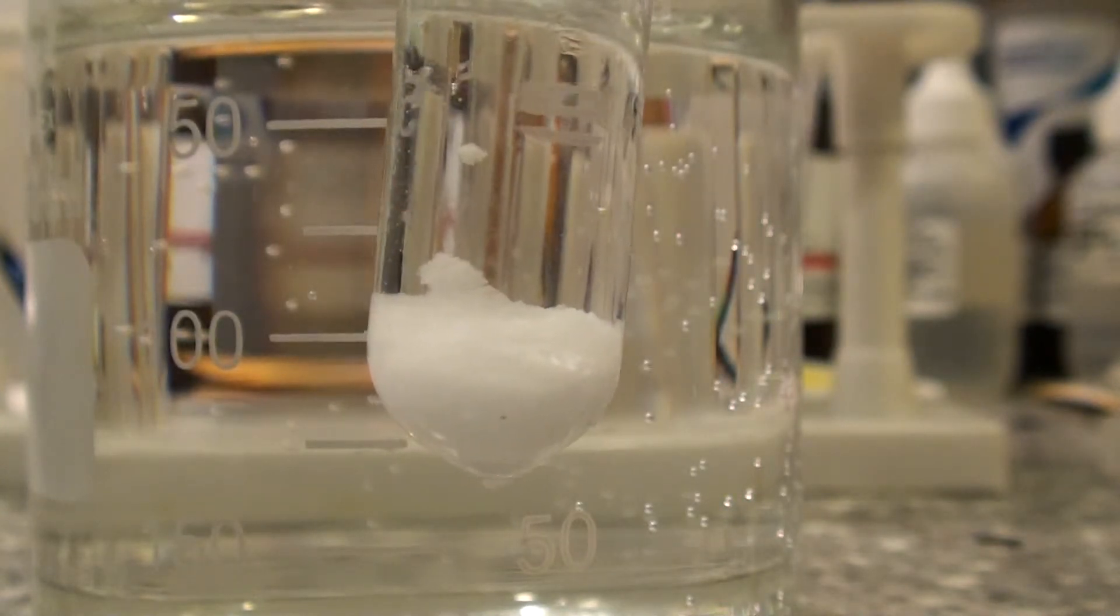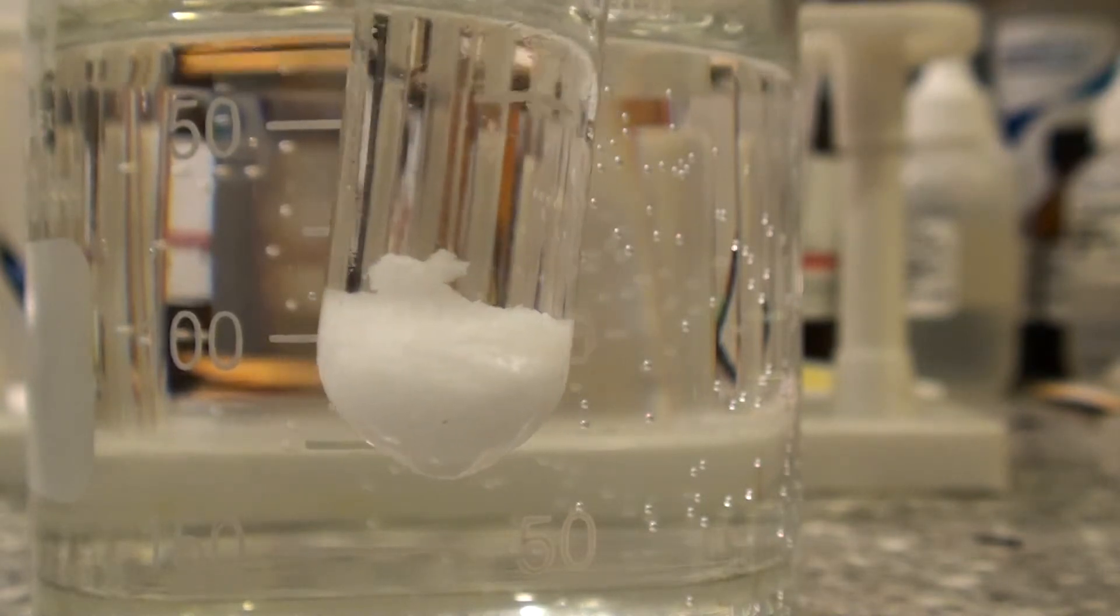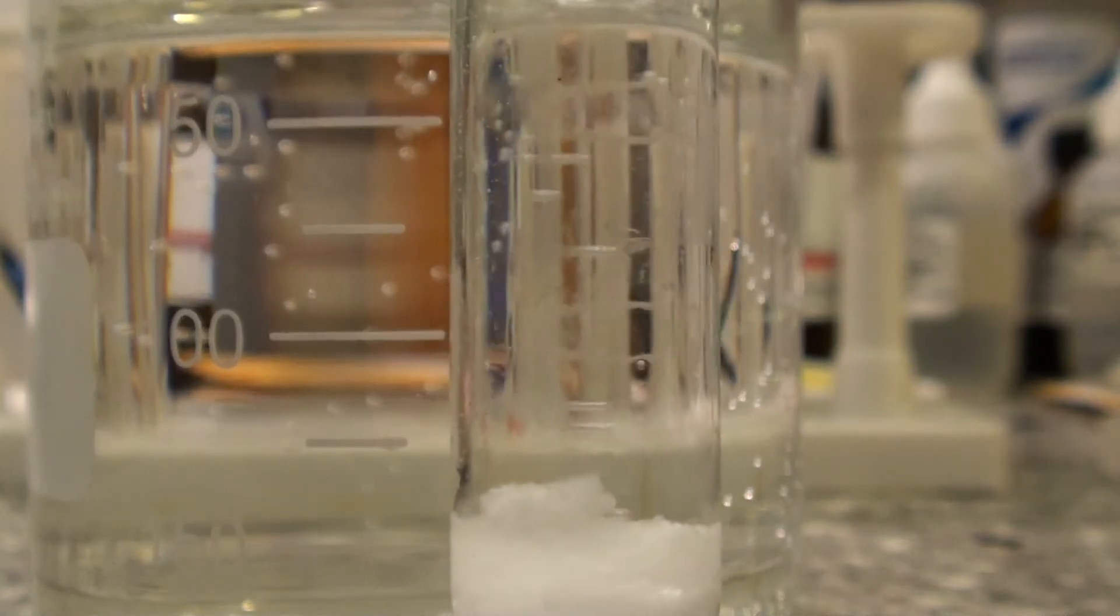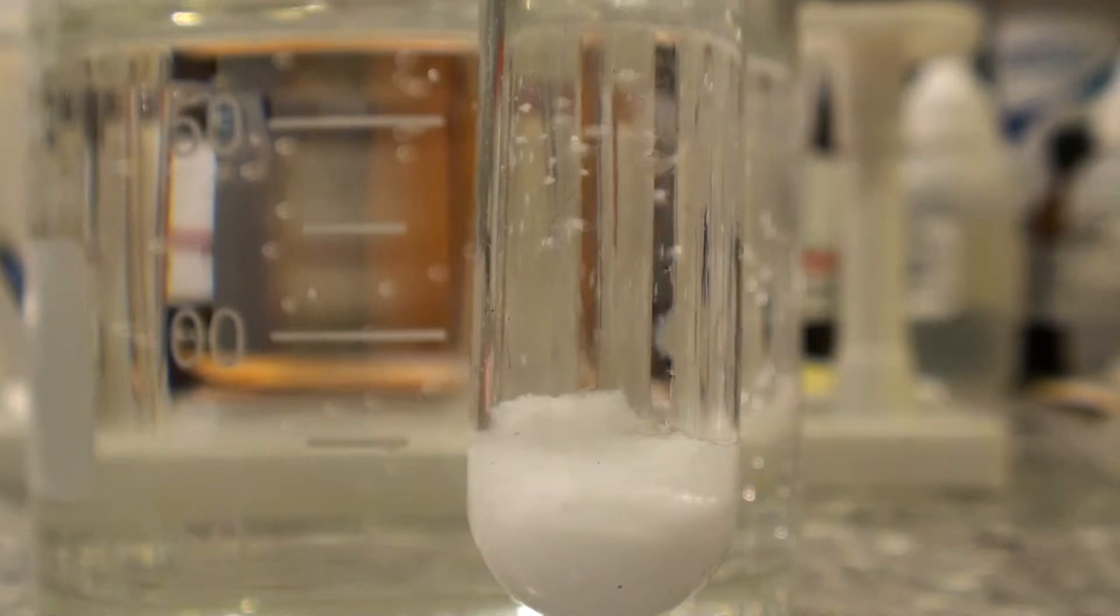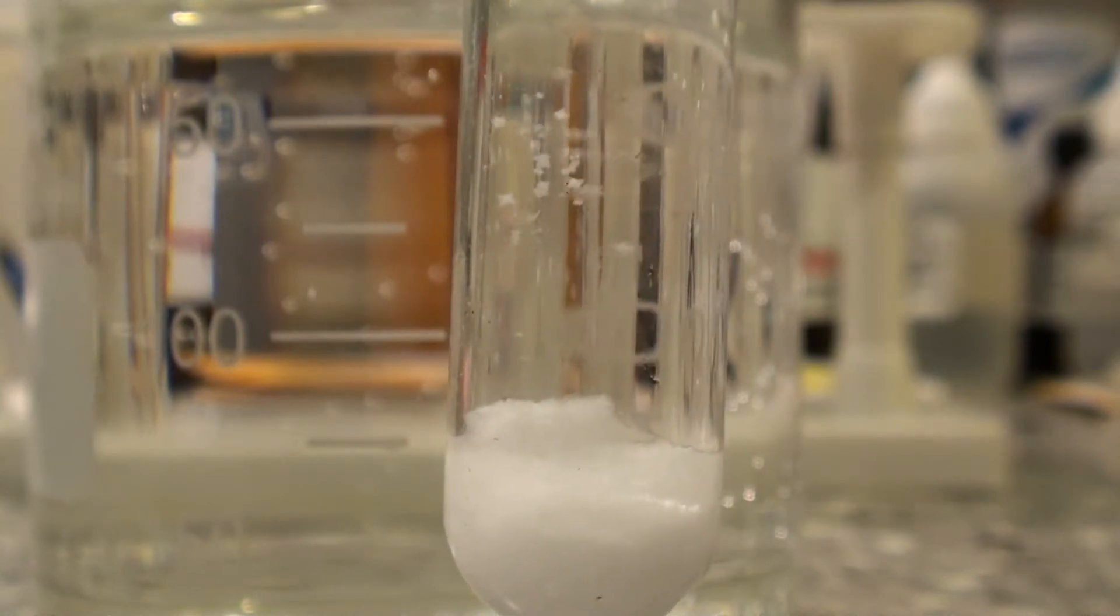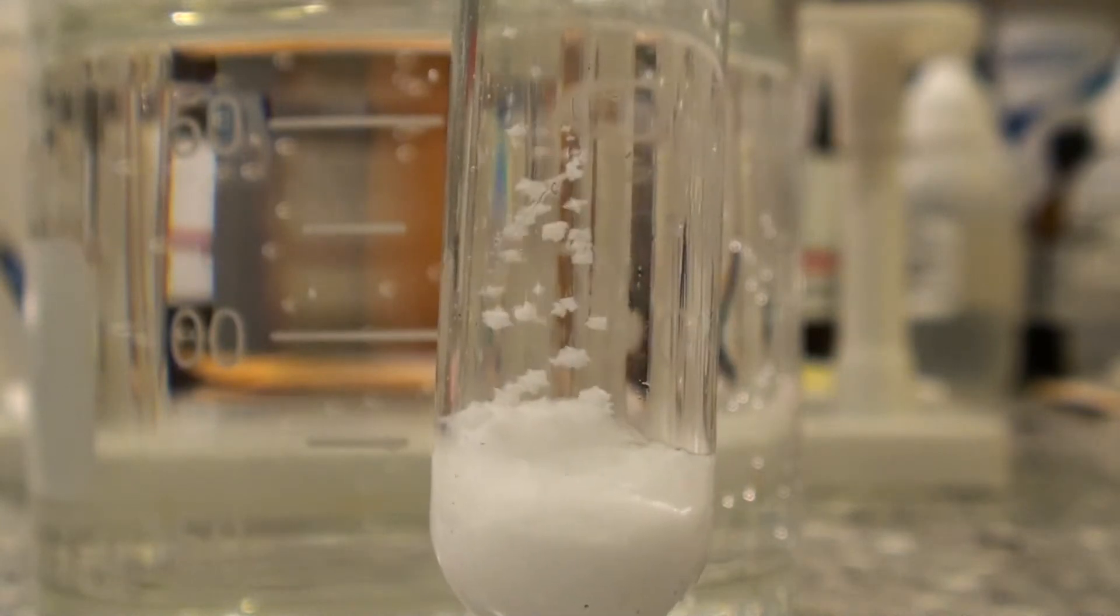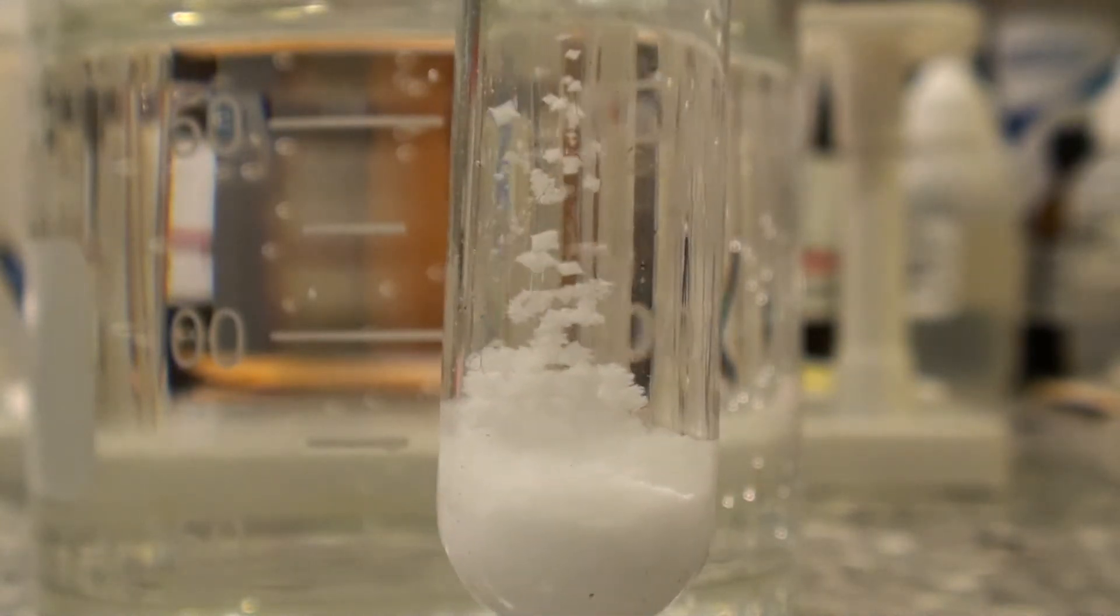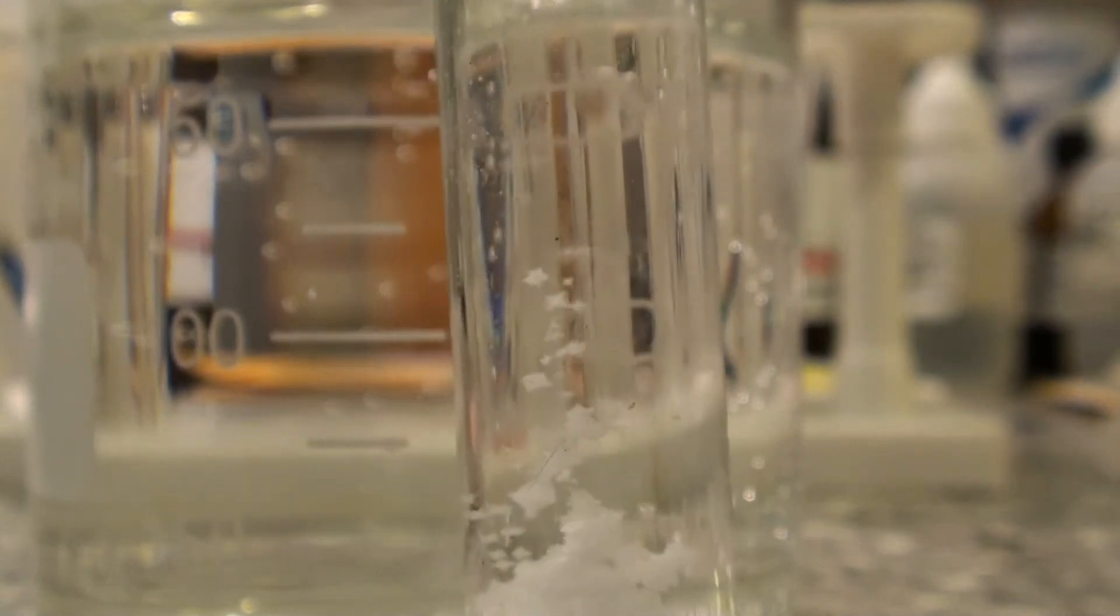As the chemical itself cools, it will become more rapid. Now, there's a lot coming out. There we go. Now, this is the actual cool stage of the recrystallization. It's more exciting.